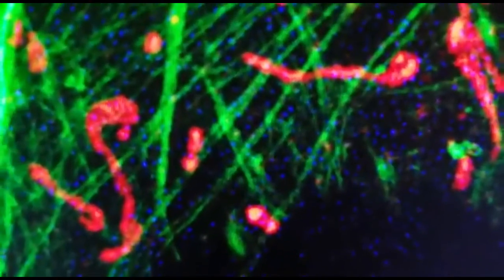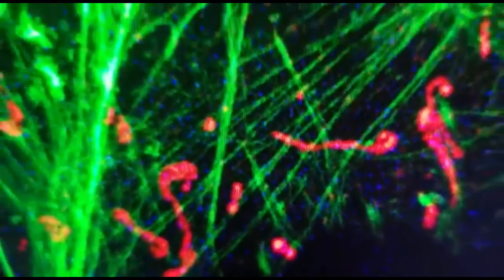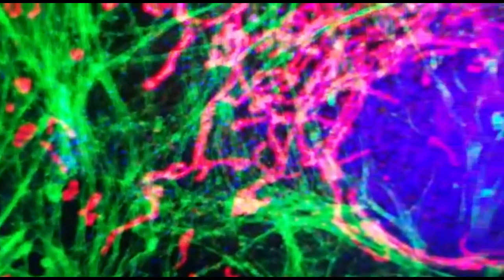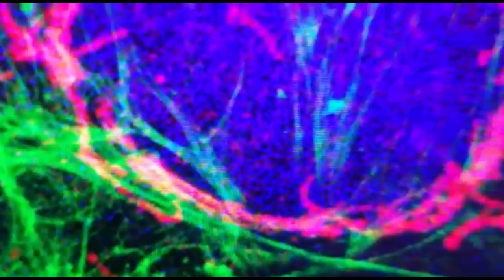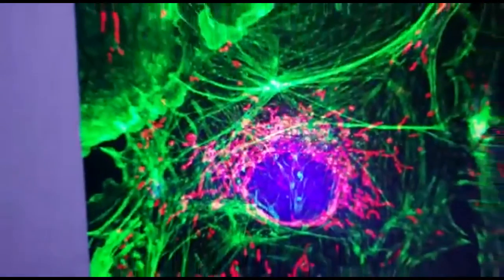Normally these kinds of techniques allow us to obtain more detailed information for a sample, and also the interaction between a sample and a processing or a treatment that we make in the sample.